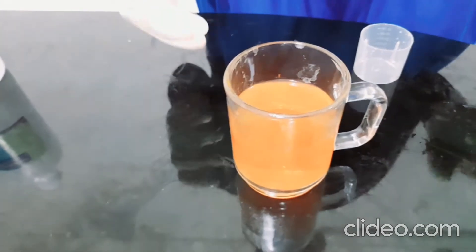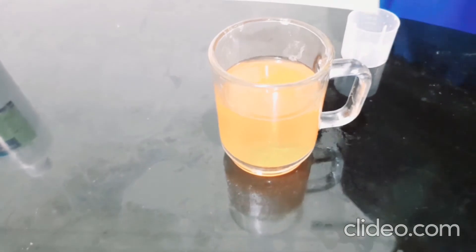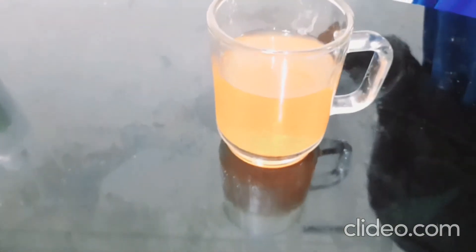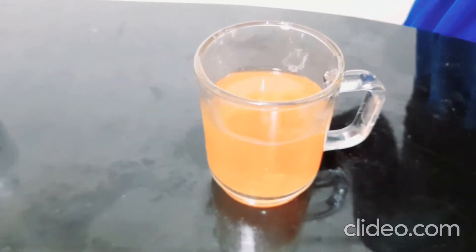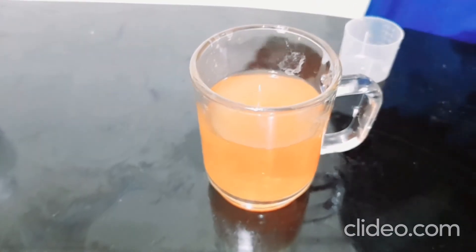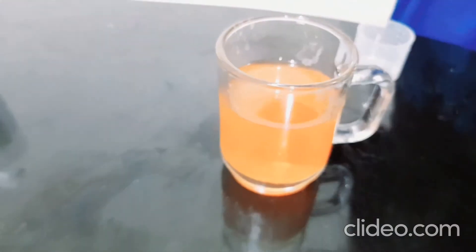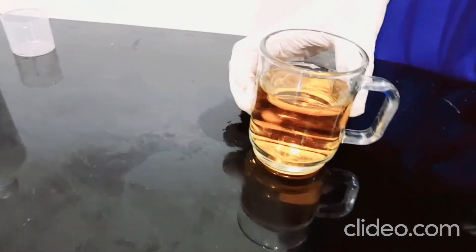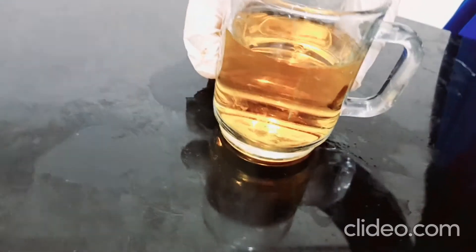Just look at the inside — it's just bubbling up a little bit and it's also kind of sparking inside, and it's also becoming a bit colorless. It's color changing! This might take up to two minutes or so to completely change to transparent, so let's just wait.